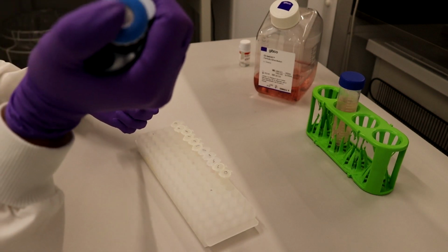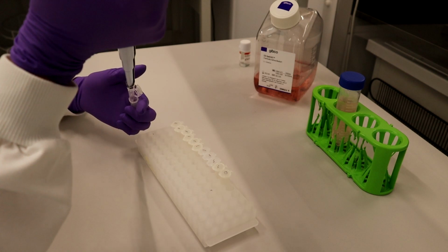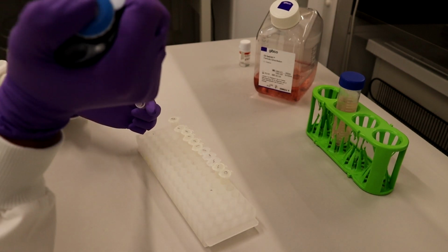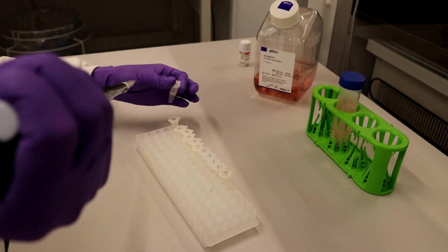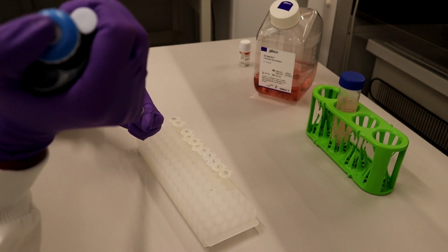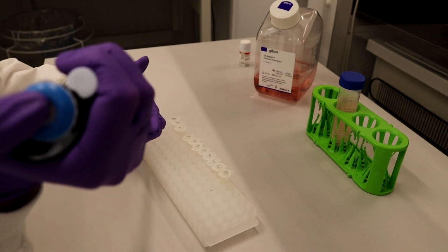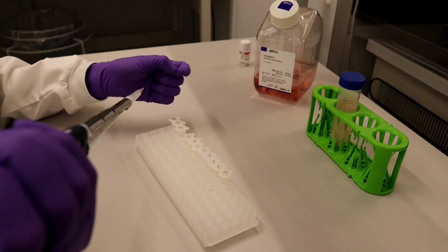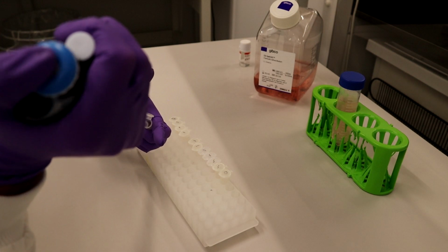To begin, check the stock concentration of your IgG standard molecule. If you are intending to run a low-range iCON titer assay, a 12-point dilution, which covers the range 100 to 0 milligrams per litre, should be generated. If you are intending to run a high-range iCON titer assay, a 12-point dilution, which covers the range 1,500 to 0 milligrams per litre, should be generated.